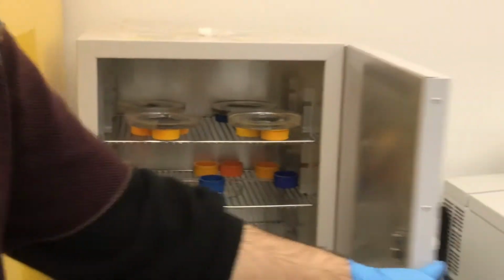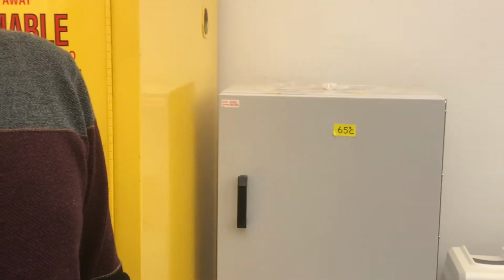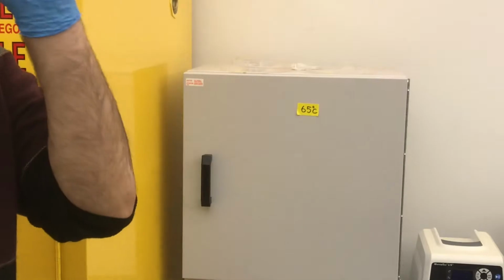That as soon as you remove the cap, you should put it in. And also do not talk, even. You should not talk, because bubbles and particles may get inside.